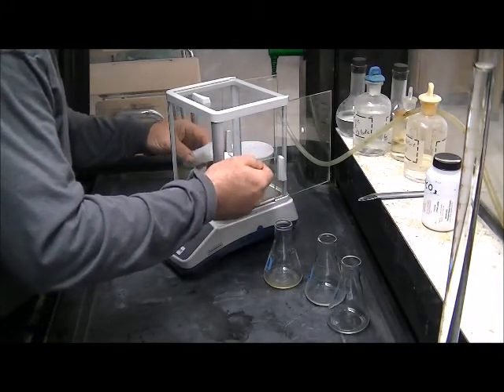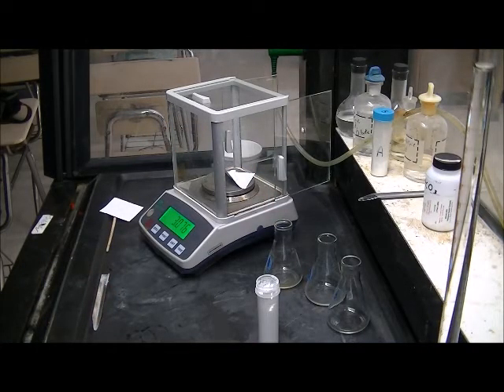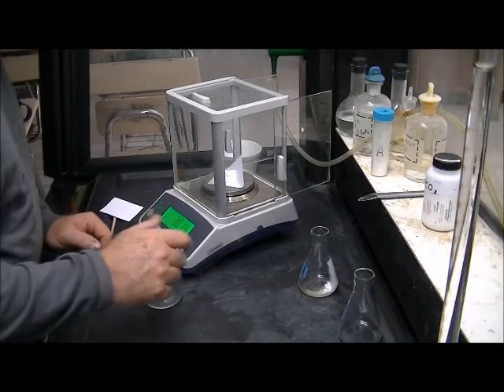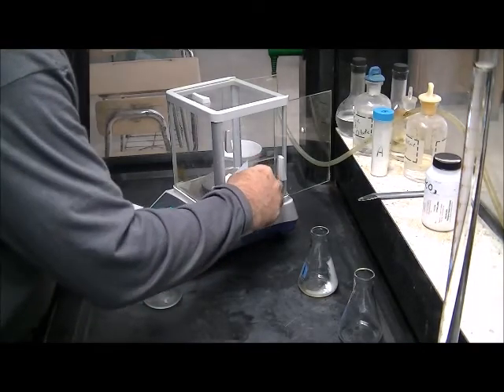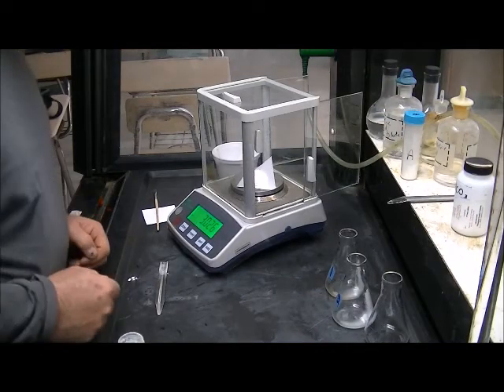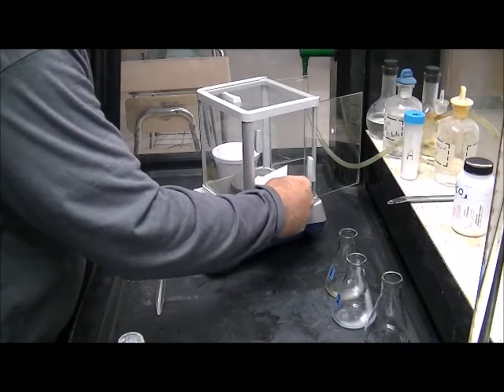So 3.076 for sample 1 of B. Sample 2 of B is 3.014. And sample 3 of unknown B is 3.026 grams.